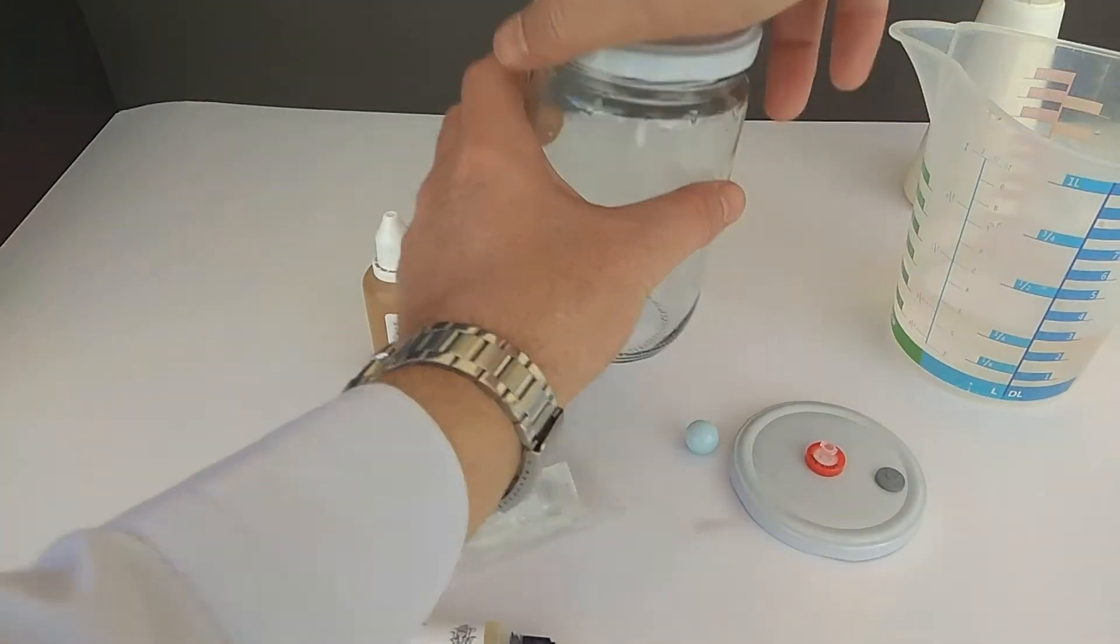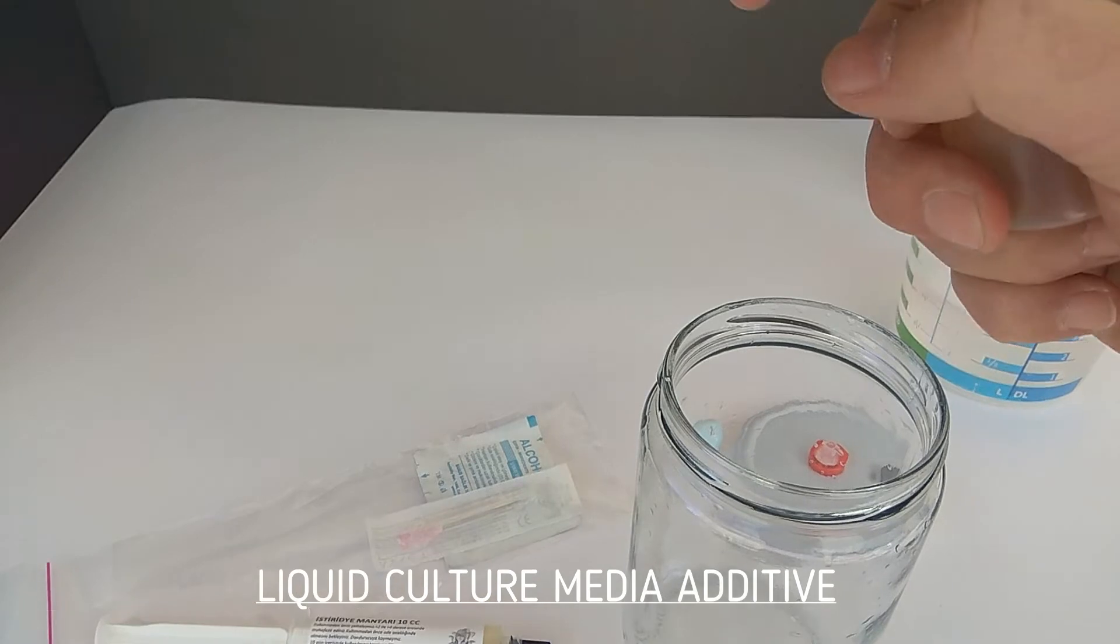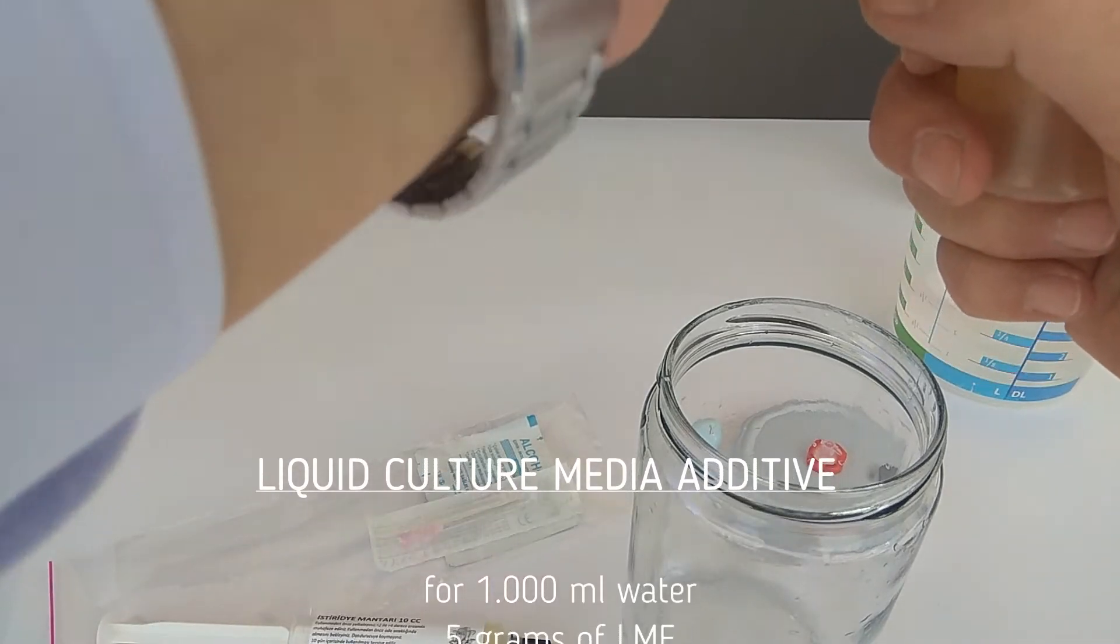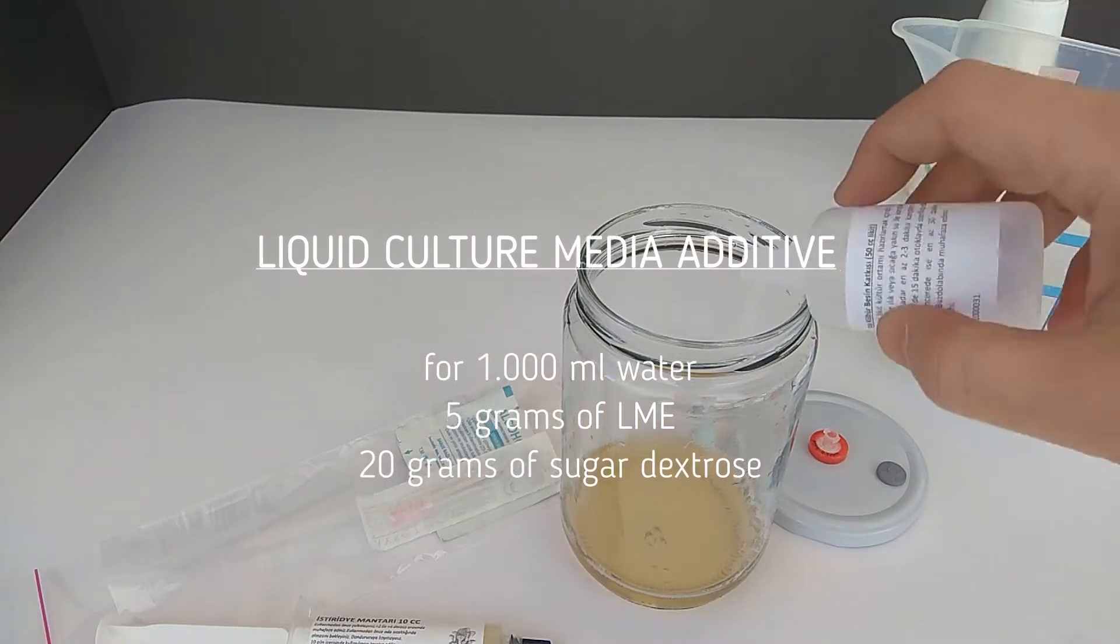Here, we used concentrated liquid additive prepared for 350ml. However, you can also use powder additives. I will show the formula of the powder additive on the screen.